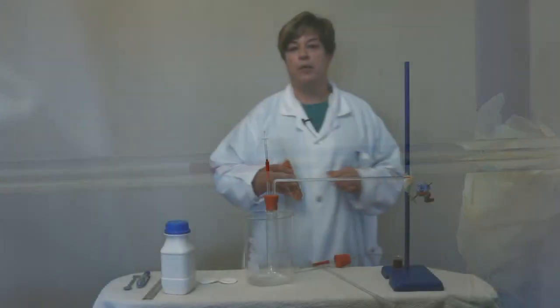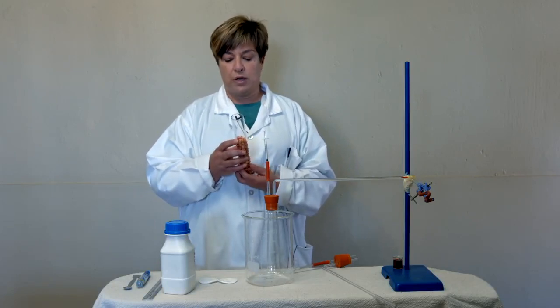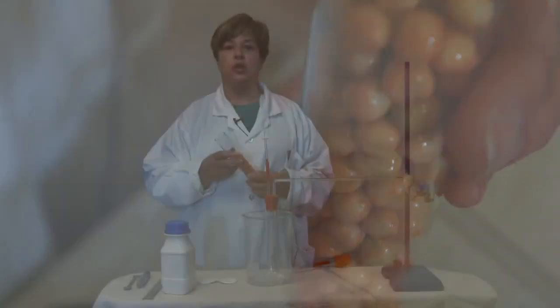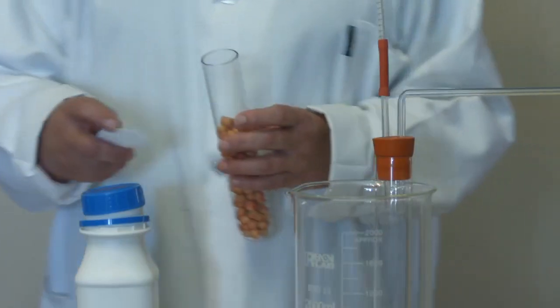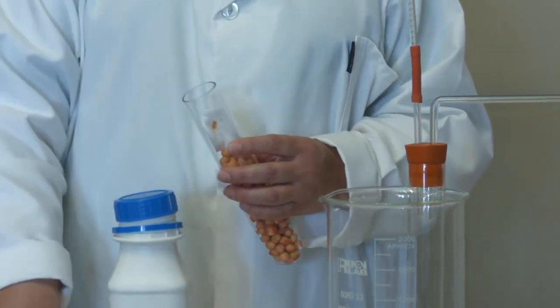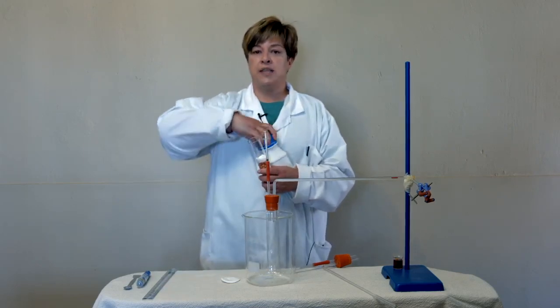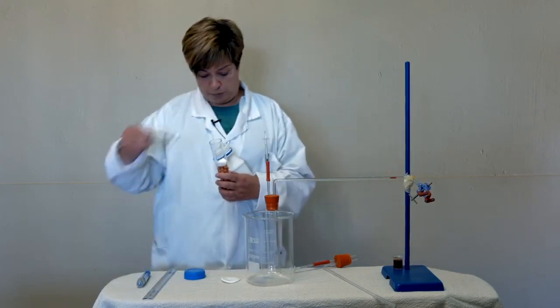Now we are going to set up our experiment with our pea seeds. We use pea seeds because they will not photosynthesize, so we won't have a production of oxygen. We will only be able to measure the usage of oxygen. And then you fill the pea seeds only about 3/4 of the way, and then we put the cotton wool on top. The cotton wool is just so that we can separate the soda lime that we are going to layer on top of these seeds.